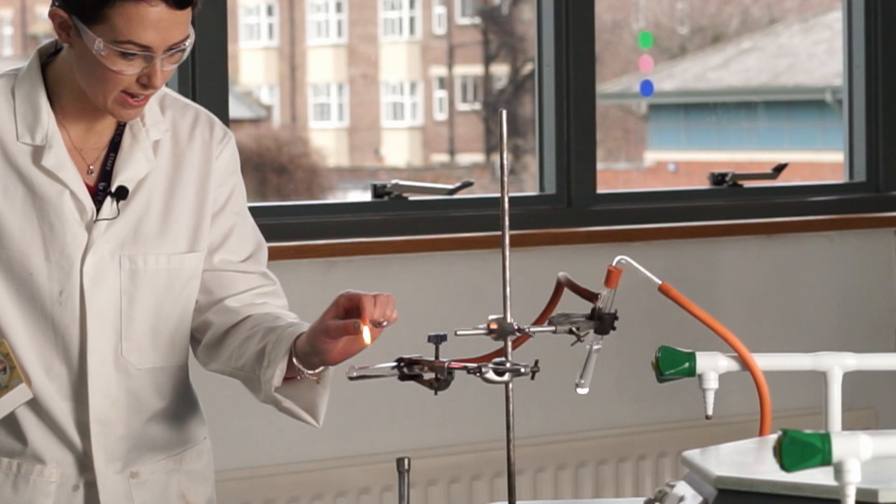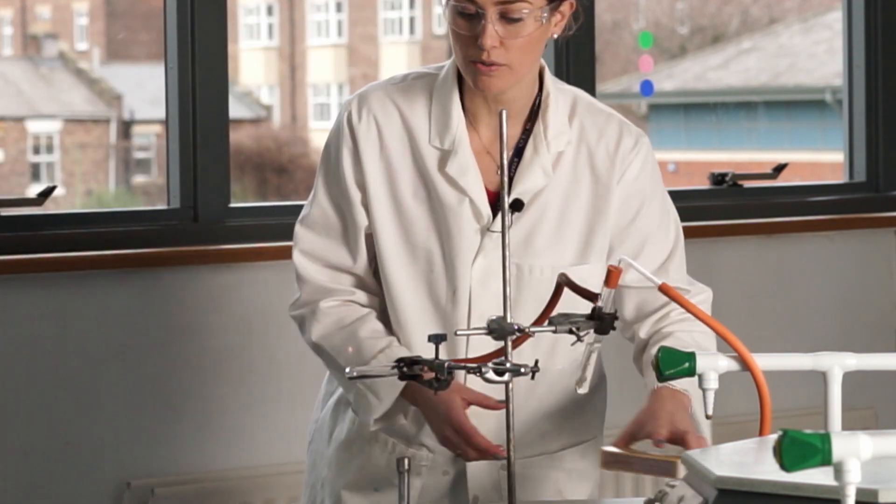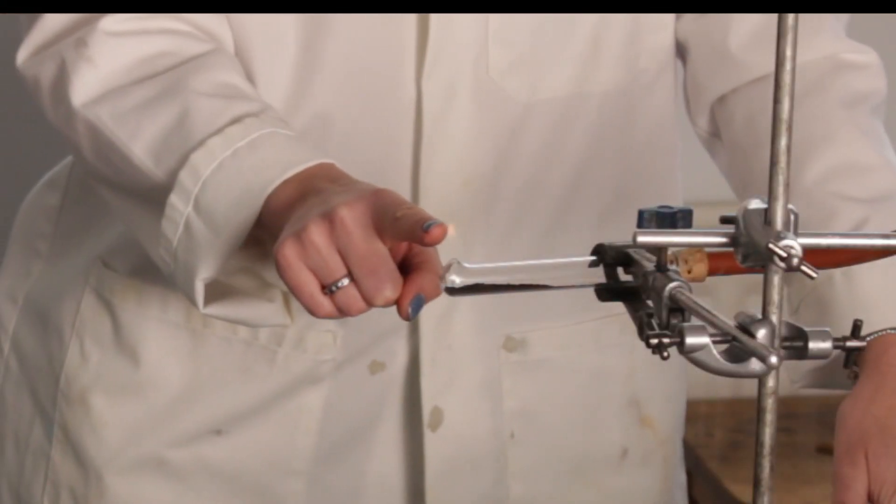And I'm now going to light the methane coming out the end of the reduction tube. There's a very gentle flame there. It is lit. I don't know if you'll be able to see that. Growing slightly larger now.